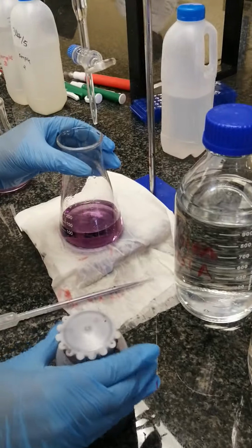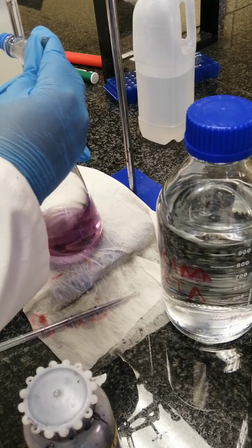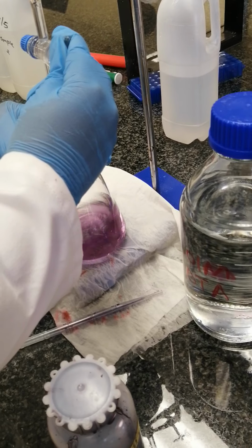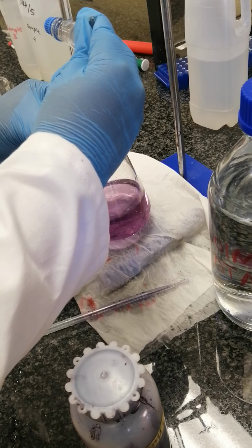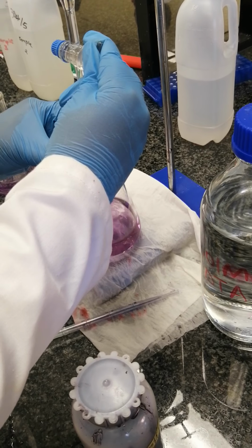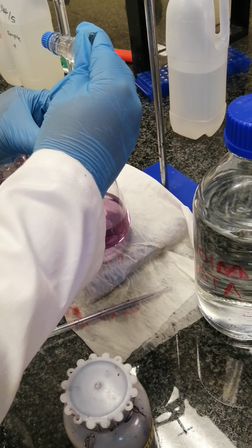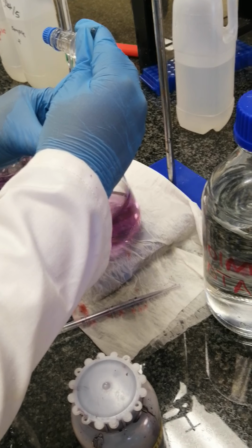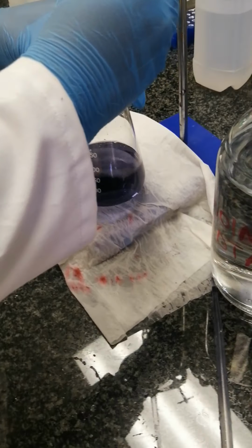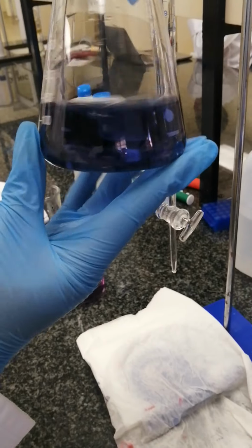So now we can start with the titration using EDTA. Make sure that you do it drop wisely up until your water sample color turns blue. So titrate drop wisely up until your water sample color turns blue. It's supposed to change from this wine red up until you get a blue color. You titrate up until your water sample turns blue. As you can see, the water sample changed color.